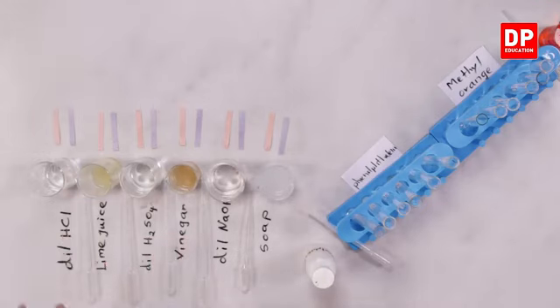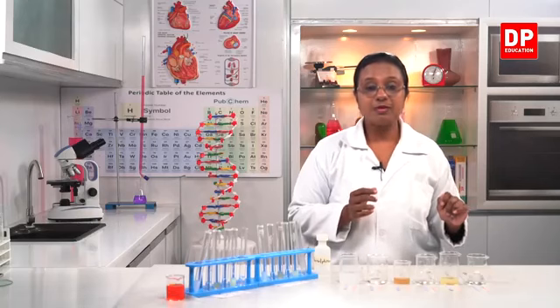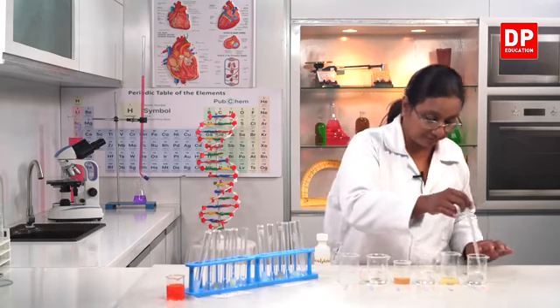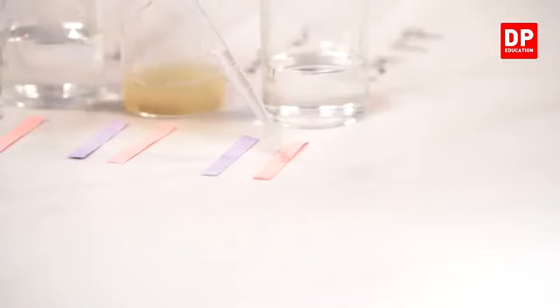So I will put a drop of the solution to the litmus paper. And students, again here this is a tile surface. So directly I can place the litmus papers there and put the solution on it. So no problem. So first I'll start with the dilute hydrochloric acid to the red litmus and the blue litmus. You can observe the color change there.